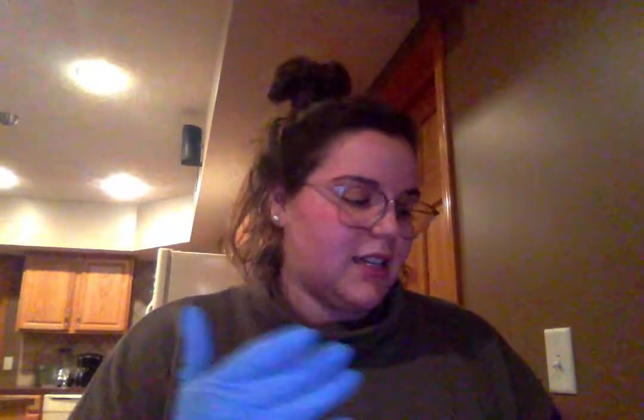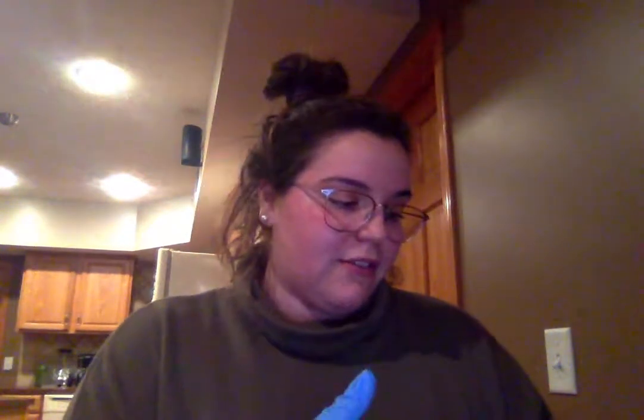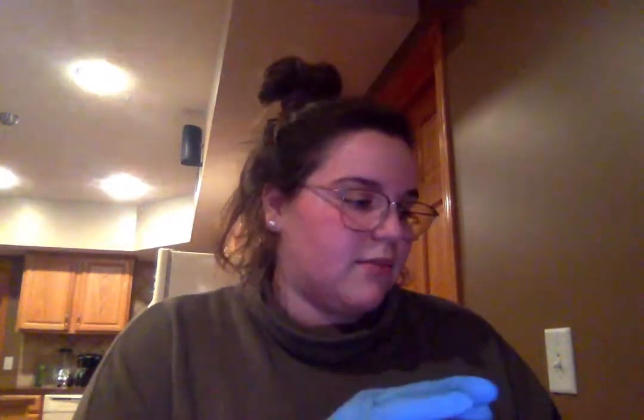I had a little bit of a difficult time dissecting this properly. I feel like my heart was shaped weird, and I had a difficult time deciphering which side was left and which side was right until I cut deep enough in the ventricles where I could see the thickness of the walls change. So my heart's kind of cut up in a lot of different spots. Also, I'll try my best to show the internal structures. I think it might be a little bit difficult, but like I said, I'll try my best.